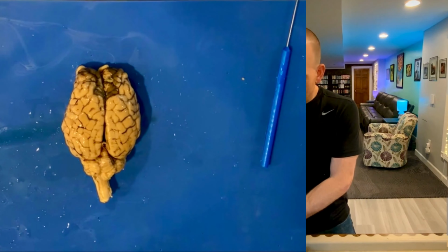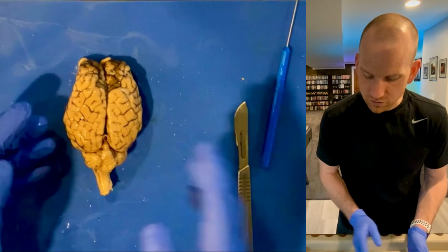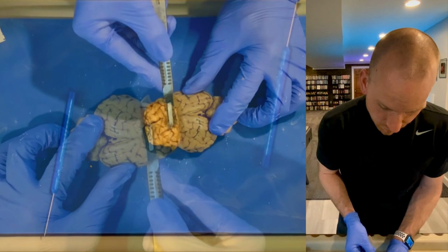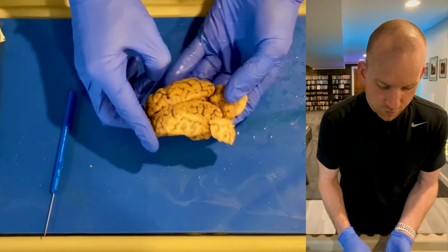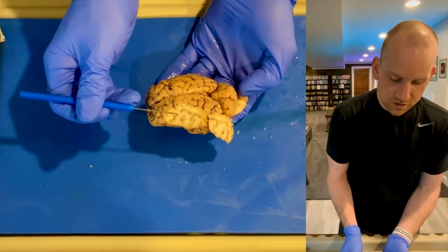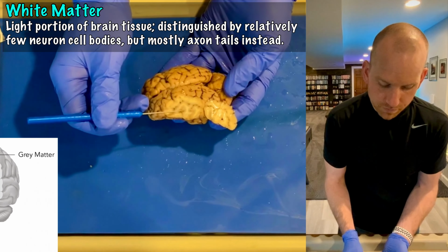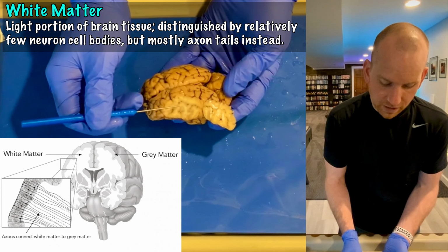So before I cut into the brain to actually show you the structures that we can see inside, I did want to show you one other thing. So I'm actually going to shave a bit of brain off here. And if you look really closely, what's really cool is you can see that the brain has multiple colors to it, right? You can see this really light color right here. That's called the white matter of the cerebrum. And then there's another shading right there called gray matter.